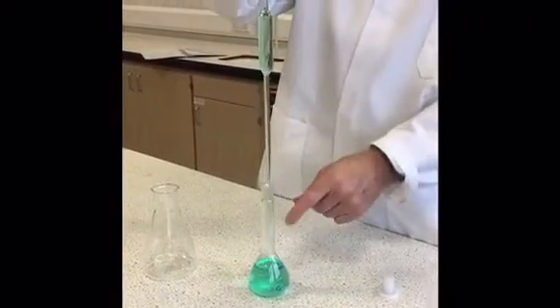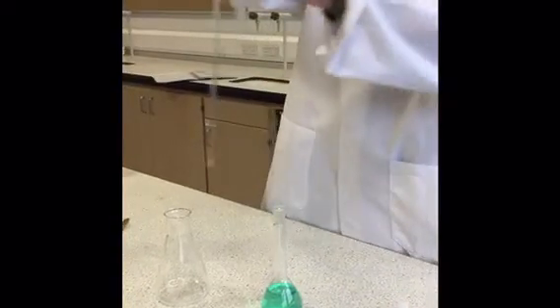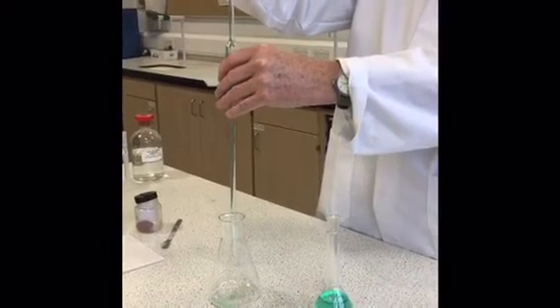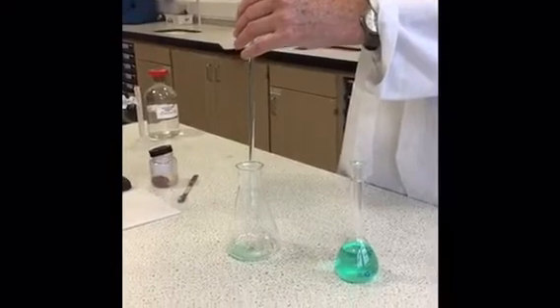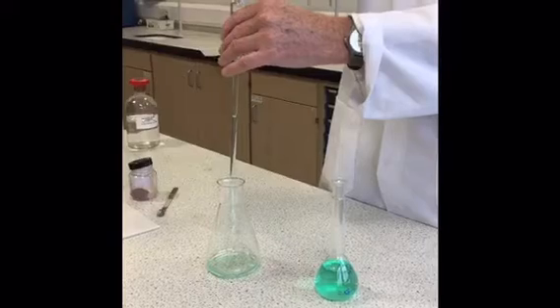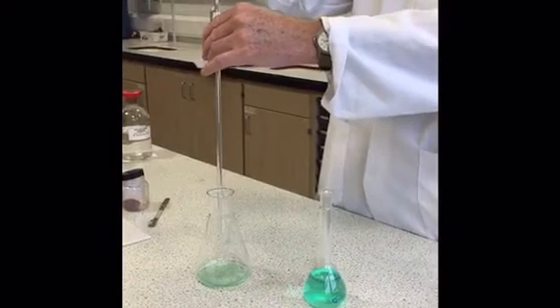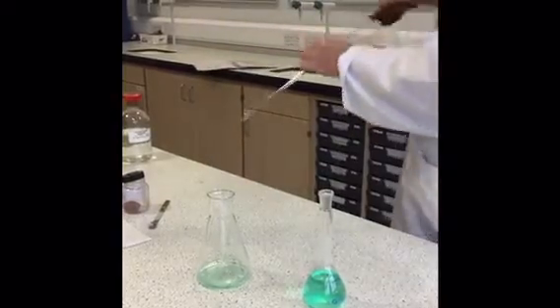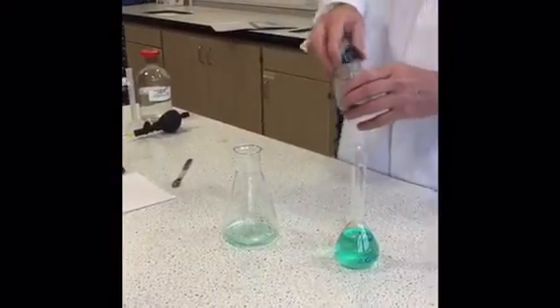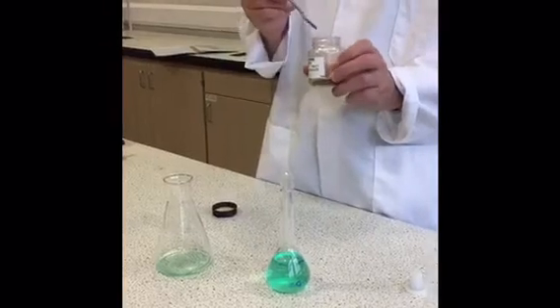Okay, we now transfer 20 ml of the nickel salt solution into the conical flask. We have, of course, already washed out the pipette with a few mils of our nickel solution prior to getting the 20 mils for transferring. We then add very roughly 0.05 grams of our murexide, which is going to be our indicator for the titration.